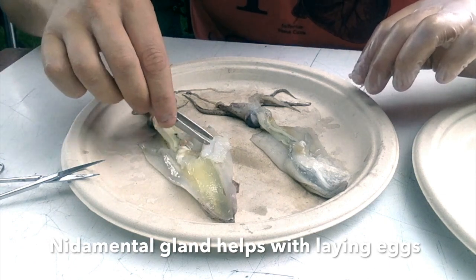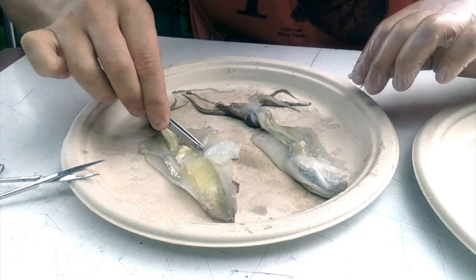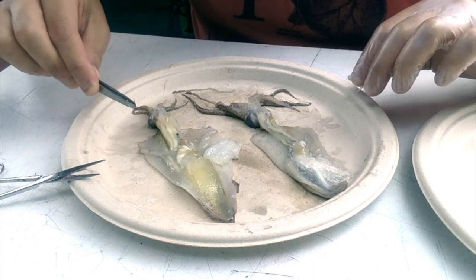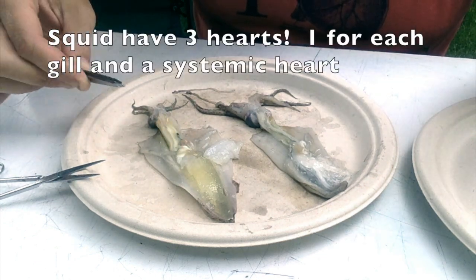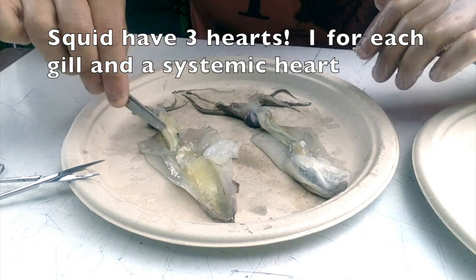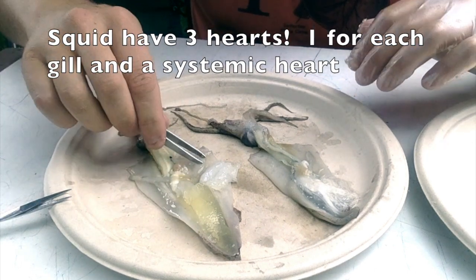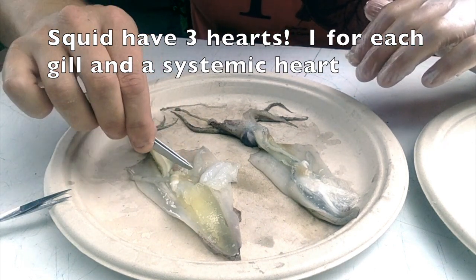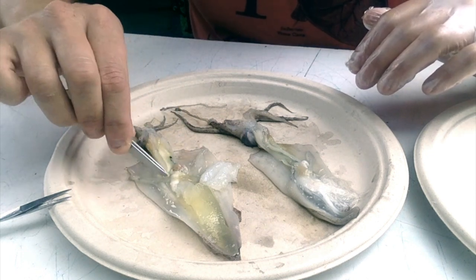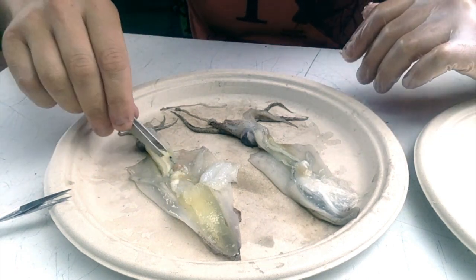In our female, which is totally intact, we've got both of our gills hanging off to the sides here, and connected to each gill is one of the gill hearts. Squid have 3 hearts. The third heart is meant to be right here in the middle, and it's quite difficult to actually see clearly, and that would be the systemic heart. So they'd have one heart connected to one gill, another heart connected to another gill, and then a central heart to pump the blood out to the rest of the body.